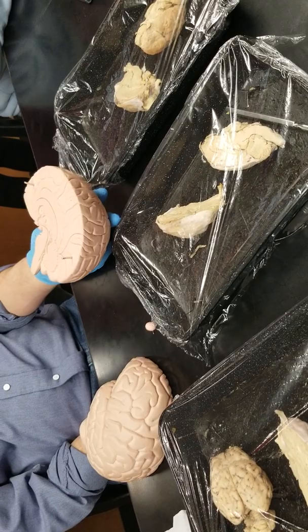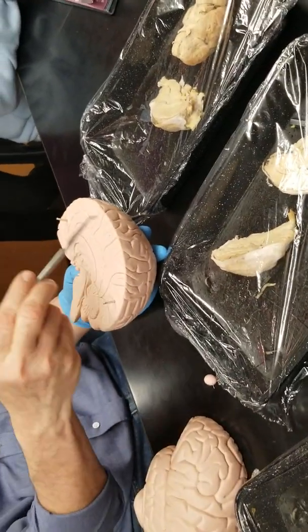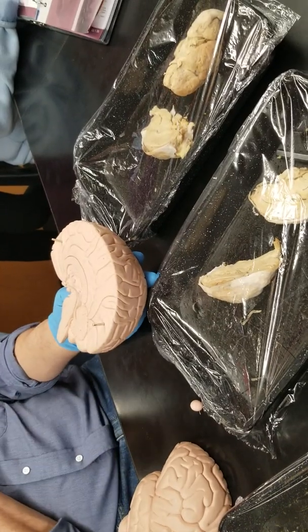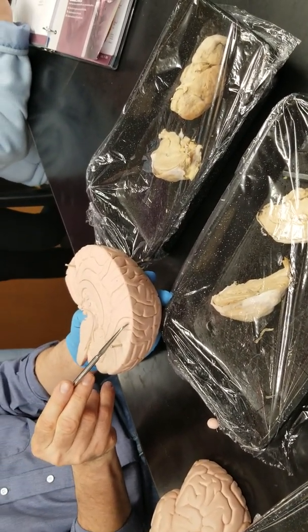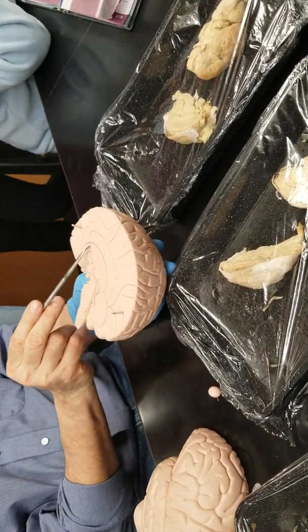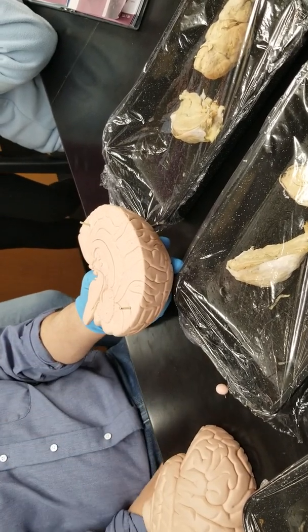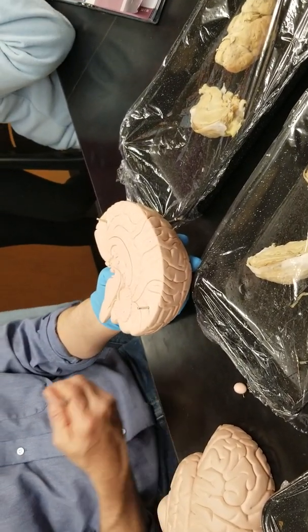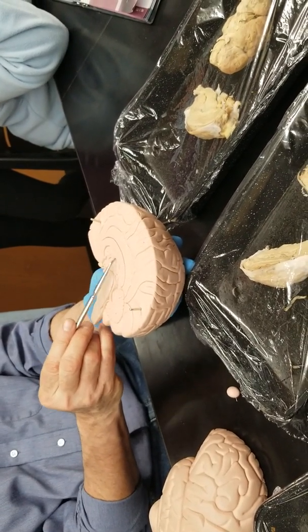Some of these things I've been pointing out on the surface, and some we've already been seeing in sagittal section. The cerebrum is everything basically from the fornix up. That's all cerebrum, the gyri and the sulci, which we can see again here in section. And the corpus callosum is a big bridge of white matter connecting the two cerebral hemispheres. The fornix here is also a tract of white matter between the two hemispheres.